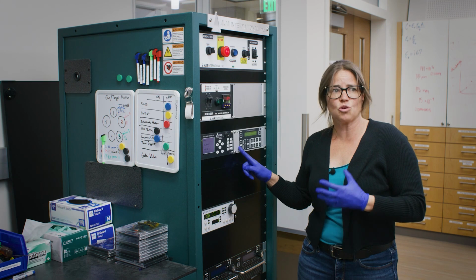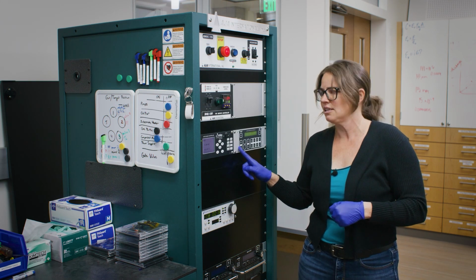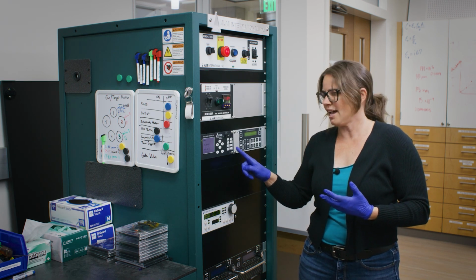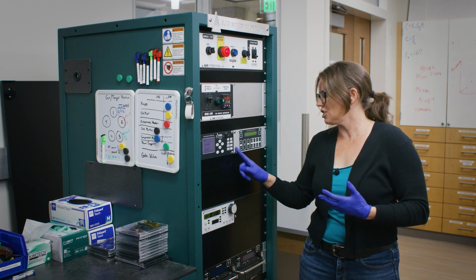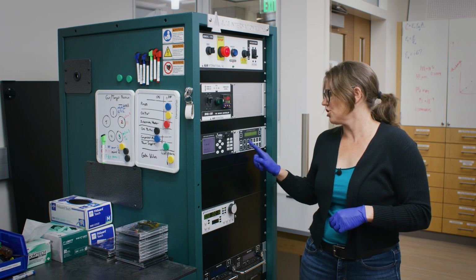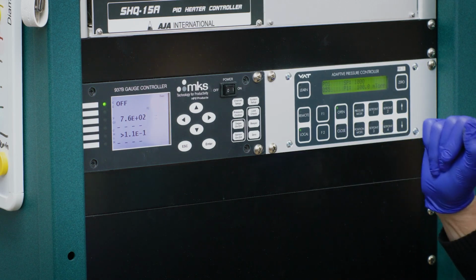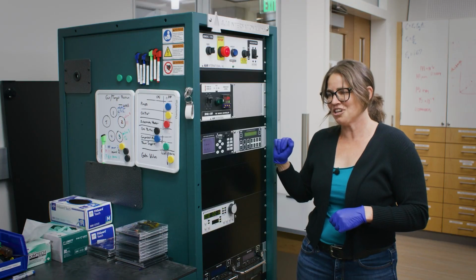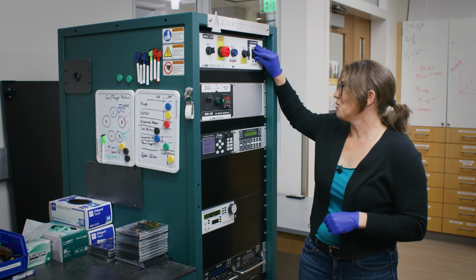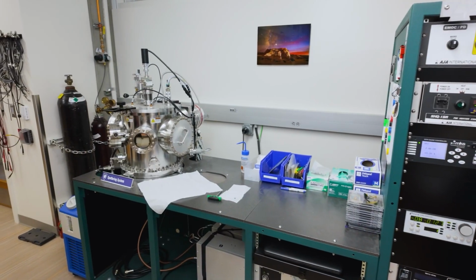And so it controls the valve system that determines what pressure the system is at. So really in the next few minutes, we'll turn on the vacuum pumps and these will change as necessary to get our system to the right pressure. All right, so now I am going to open the gate valve, which you can hear on our chamber, and I am going to turn on the vacuum pumps.